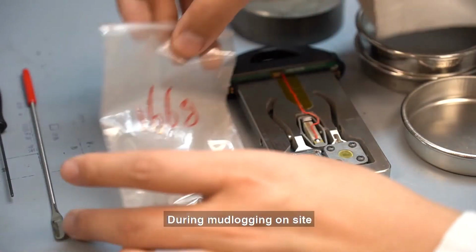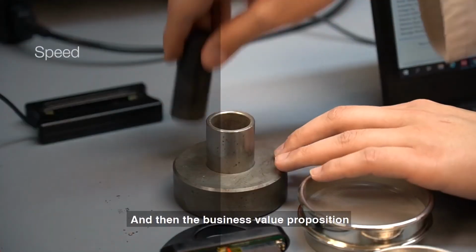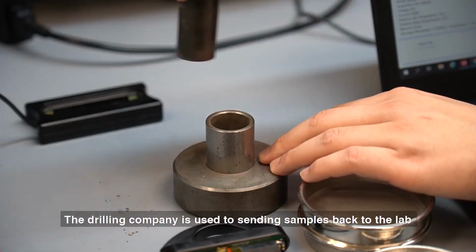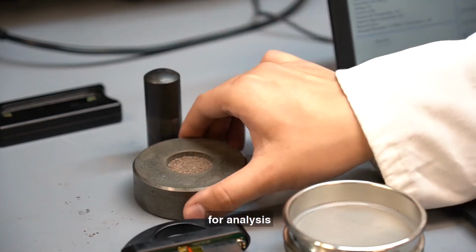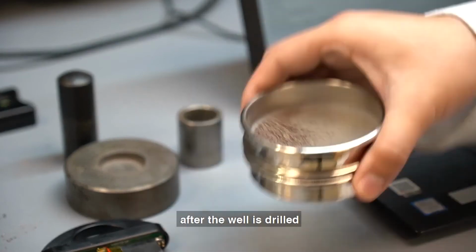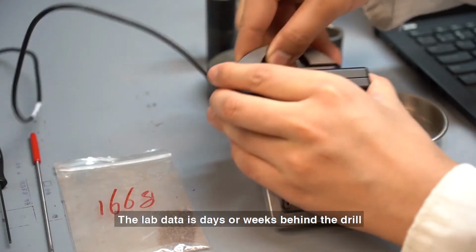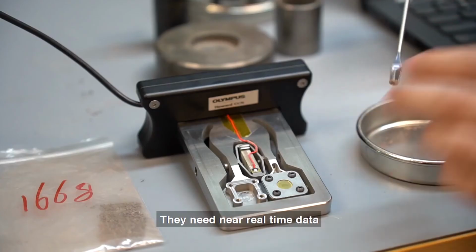During mud logging on site, the primary analytical concern is speed, and then the business value proposition. The drilling company is used to sending samples back to the lab for analysis, including XRF and XRD, after the well is drilled. The lab data is days or weeks behind the drill, so they can't use it to steer. They need near real-time data.